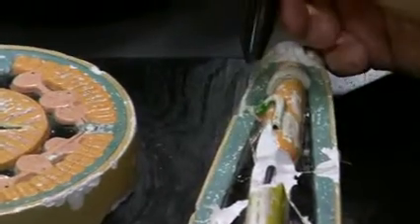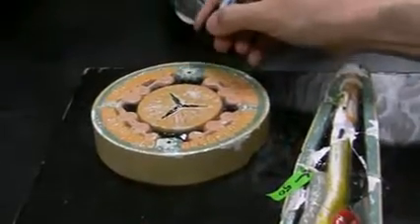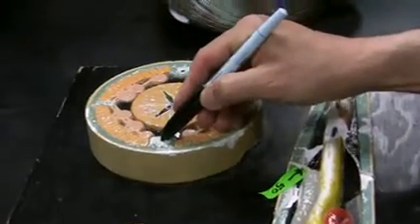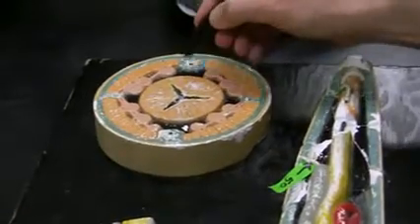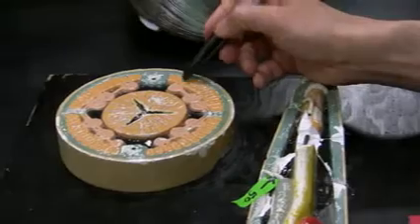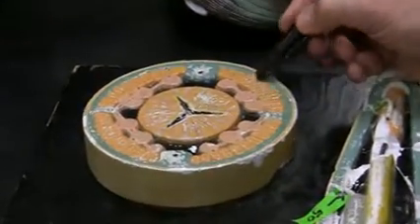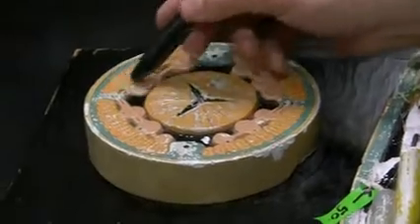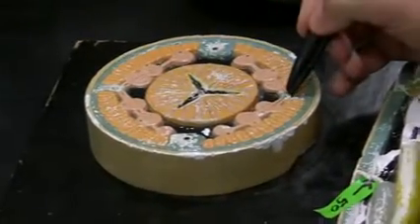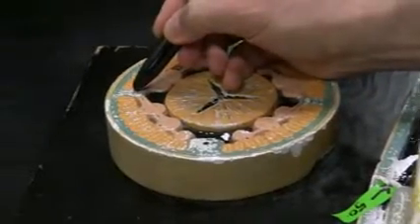The excretory canals pass through the lateral line. This is lateral line, excretory canal, excretory canal. Again, intestine, pharynx, what have you. All of this from here to here is longitudinal muscles. These are all longitudinal muscles. Nerve cord, nerve cord. Right here, that one is nerve cord. That one right there is nerve cord.